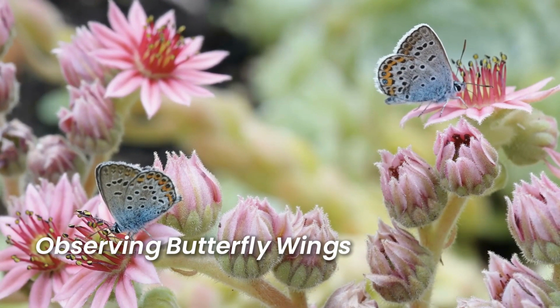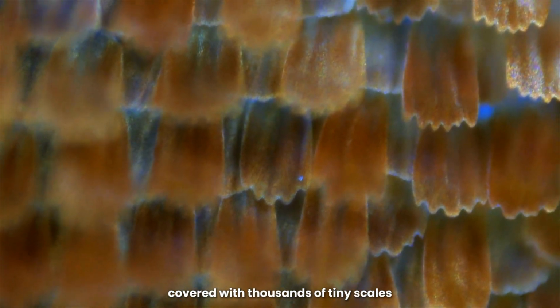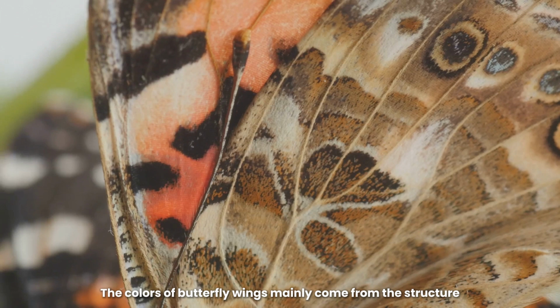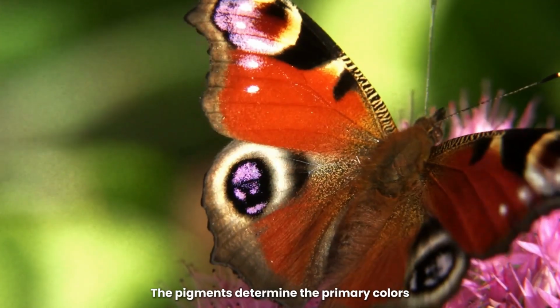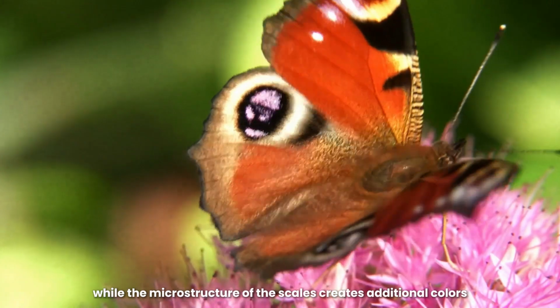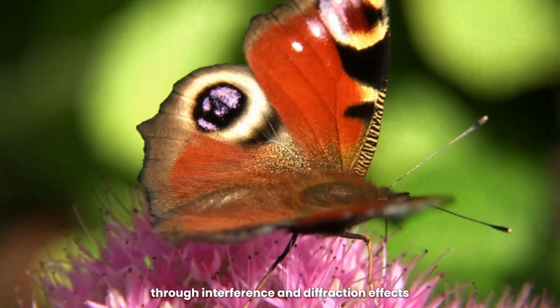Observing butterfly wings. Butterfly wings are scaly, covered with thousands of tiny scales. The colors of butterfly wings mainly come from the structure and pigments of these scales. The pigments determine the primary colors, while the microstructure of the scales creates additional colors through interference and diffraction effects.